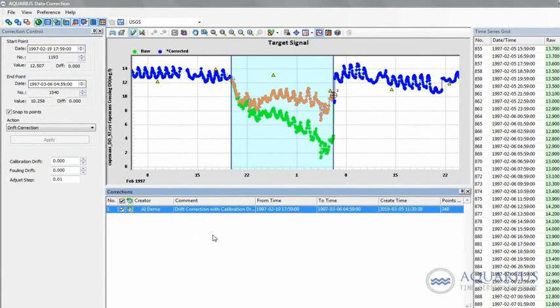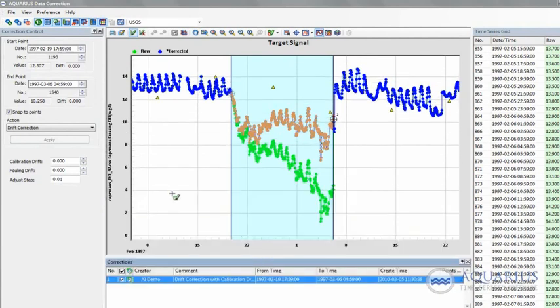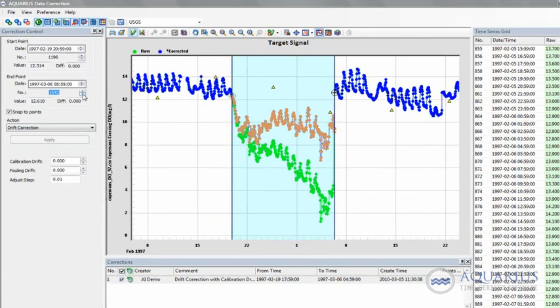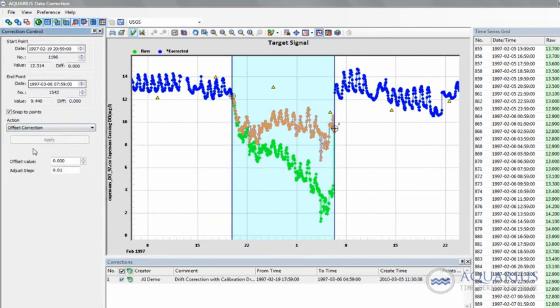So one other thing I may wish to do in this example would be to apply an offset correction. And one way I can do that is, again, the same procedure. I can highlight that region to say I'm interested in, let's say, from here to here, and again fine tune it, move that last point down. And then what I can do is select that this time we want to apply an offset correction, and again we can either type it in, use the up and down toggle keys, adjust that step that we move through that, or again just grab that section and move it up. So we're going to move it up until it kind of aligns with that discrete sample points, like so.